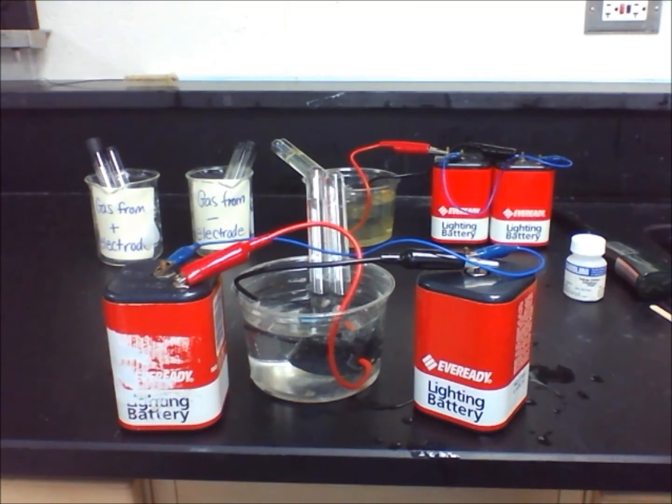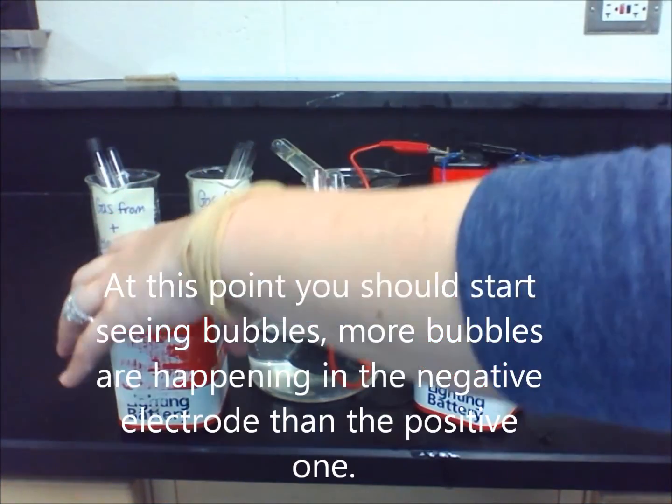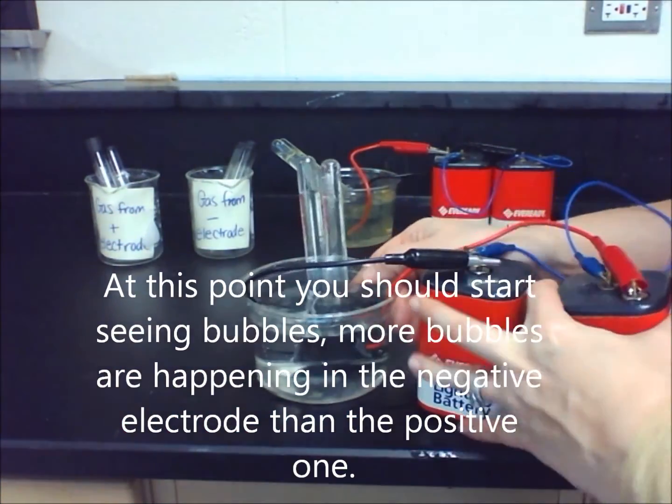If you have assembled your apparatus correctly, you should soon start seeing small bubbles coming up from the electrodes.